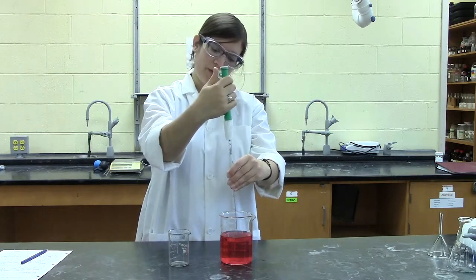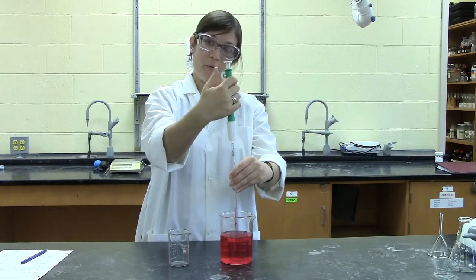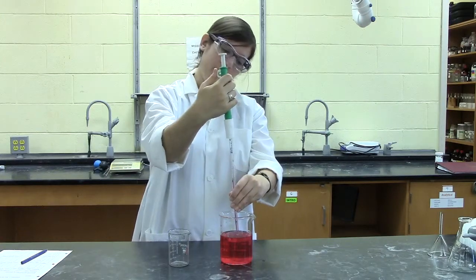The first method is to use this wheel to draw the solution all the way up to the zero mark, which, like the burette, is at the top, not the bottom of the pipette.